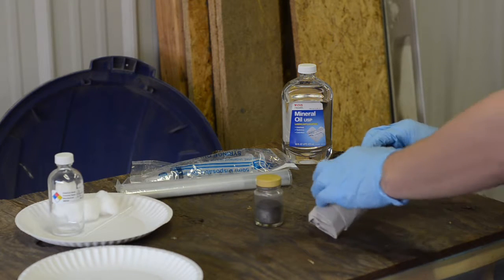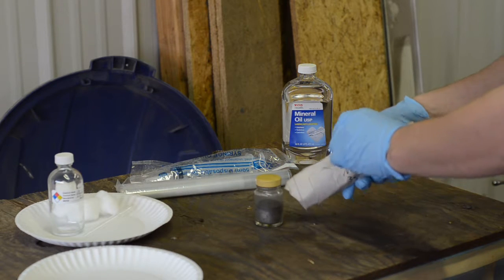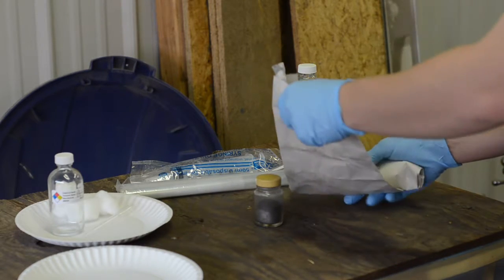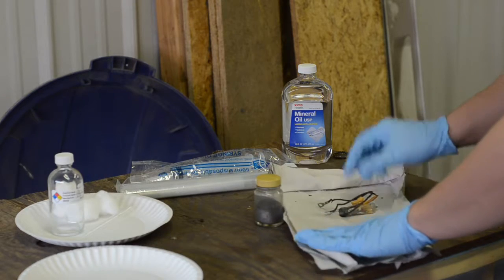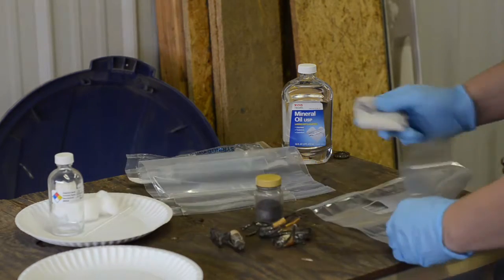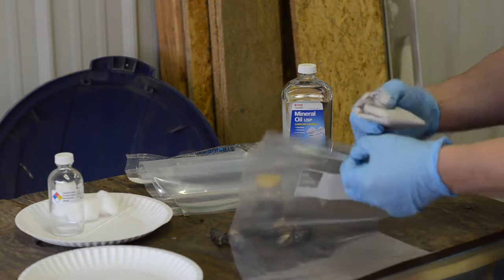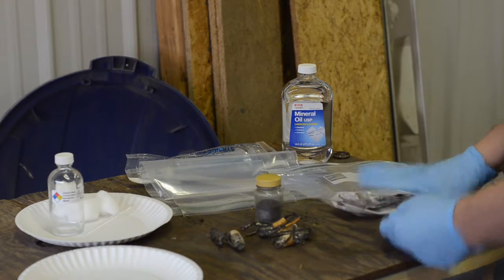I also have some mercury switches that we're going to extract the mercury from, or attempt to very carefully, because this is not really a sustainable solution either, and I don't plan on using any mercury switches anytime soon. In keeping with our paranoia theme, everything associated with this is going to be disposed of as hazmat. But, you know, we're just going to go ahead and be paranoid because that's the theme of the show today.